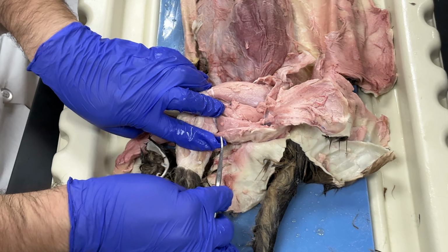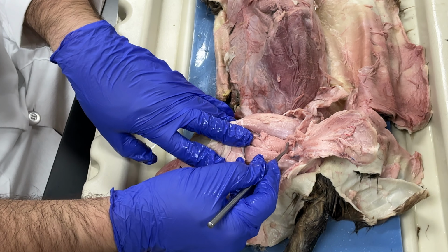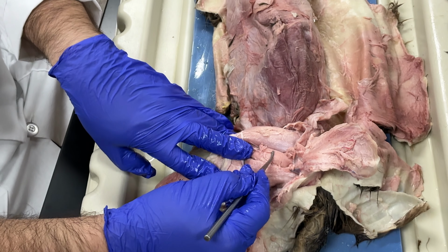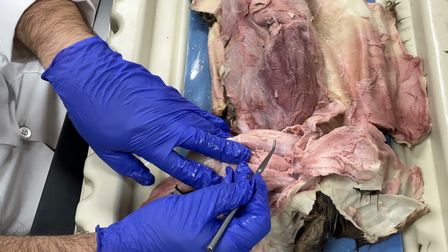This muscle that's way down here, this one, and I cut it, is called the semitendinosus muscle. And then superior to that one, this muscle is the semimembranosus. This muscle is called the adductor femoris, okay? Next, this muscle up here, and you can see where this muscle is located, this muscle is the vastus lateralis muscle.